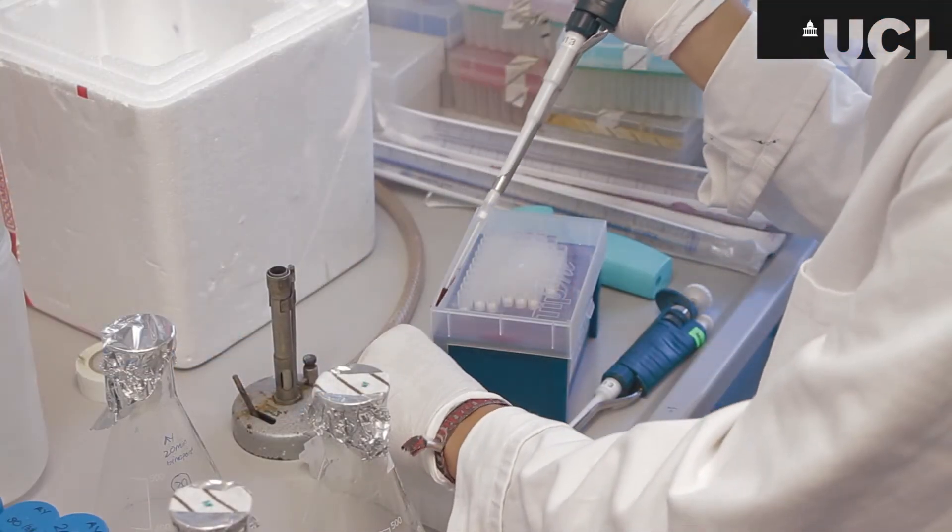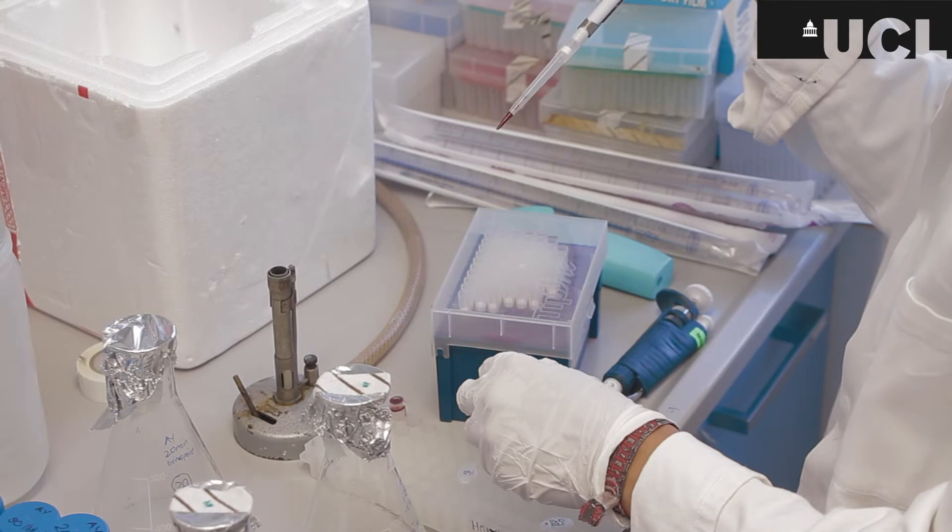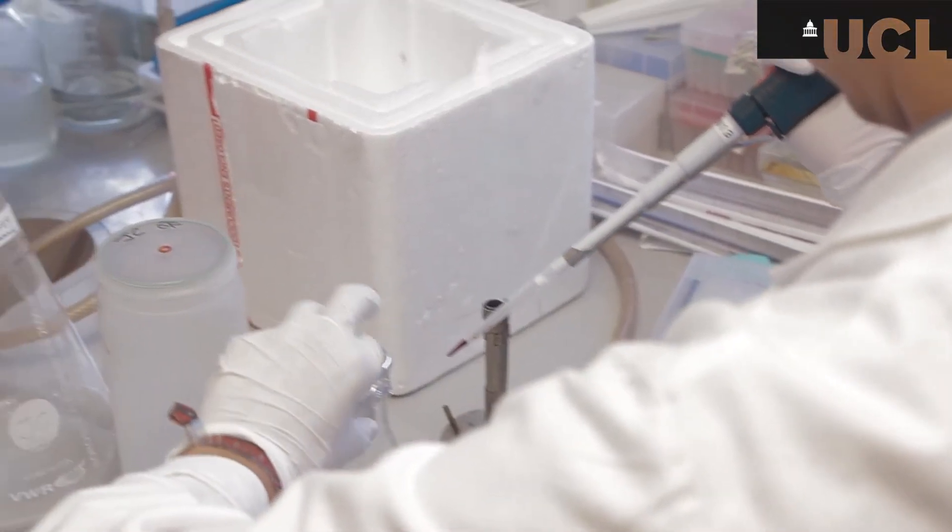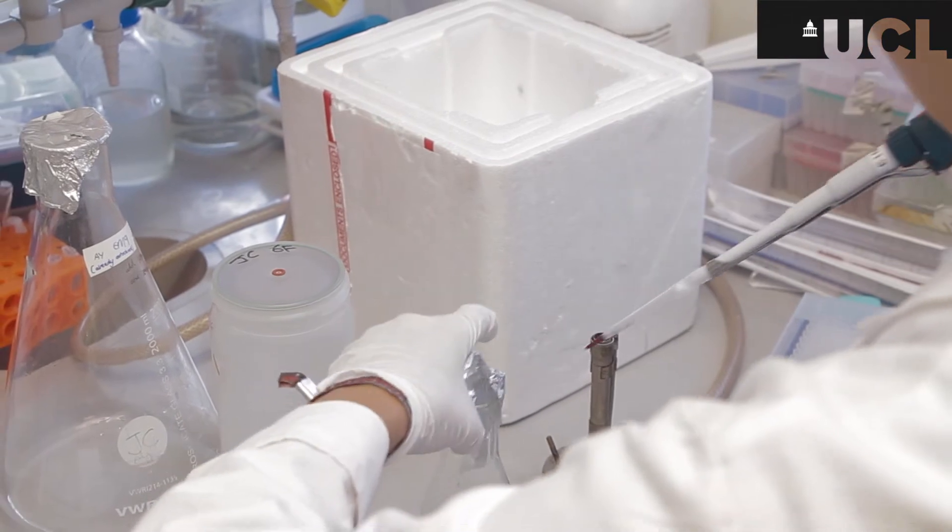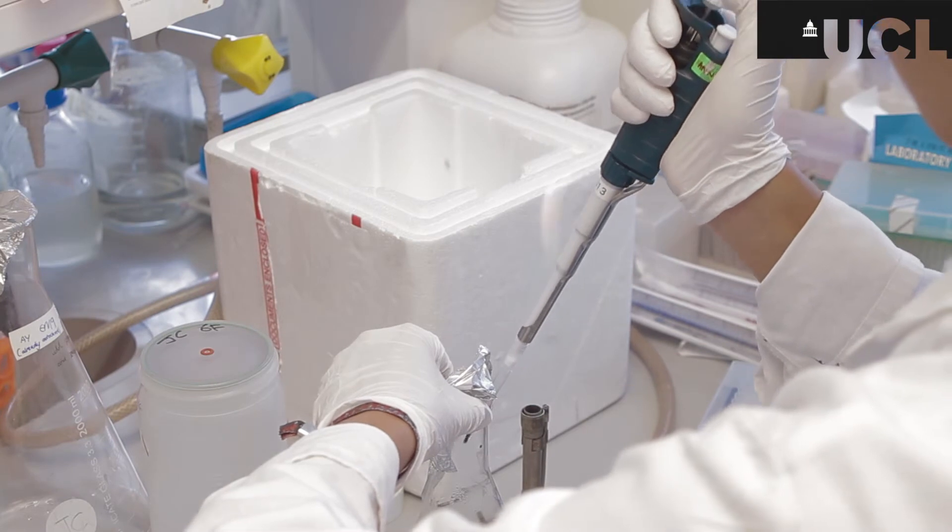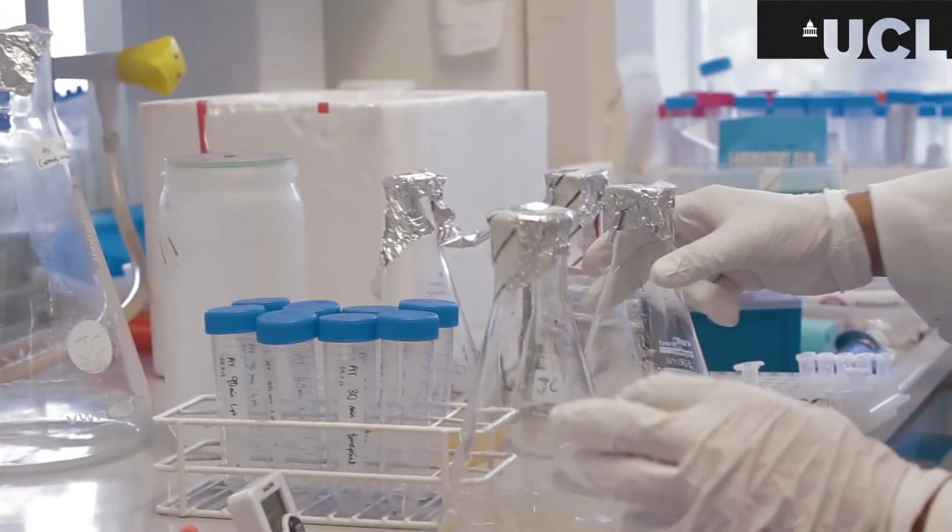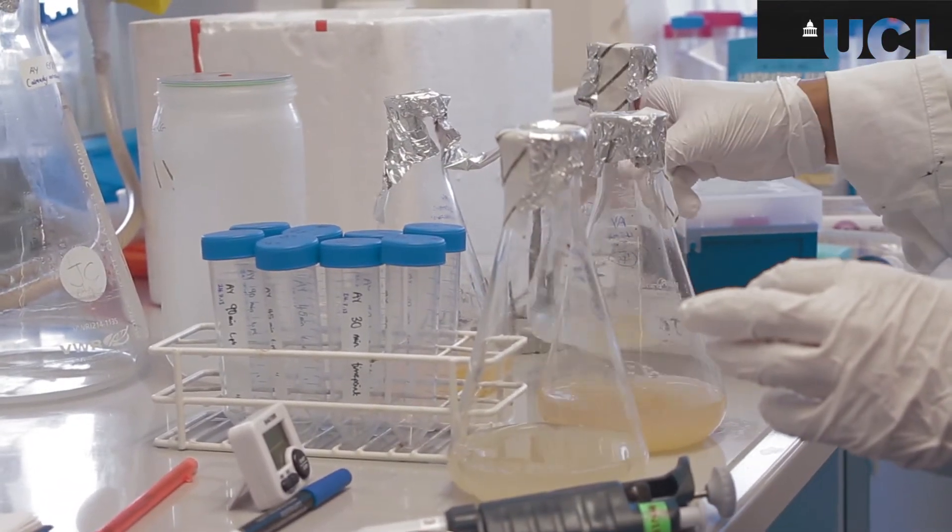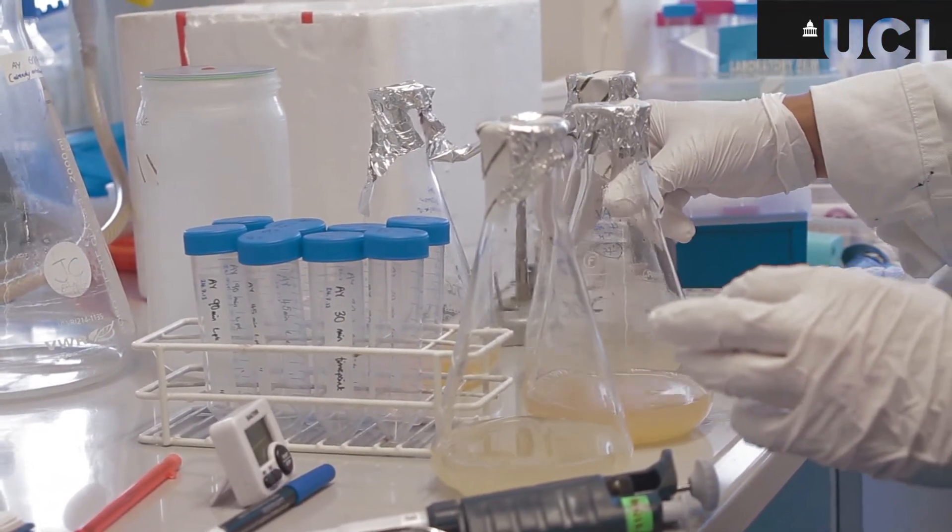Here I'm adding rifampicin, an antibiotic, into each of the separated flasks before incubation and this just helps in the selection process so those cells that haven't taken up the DNA for our protein will not also have the resistance for rifampicin so they will be destroyed so it selects for the desired cells.